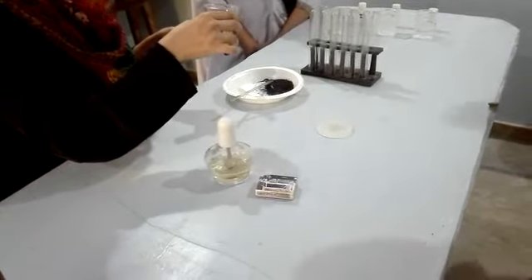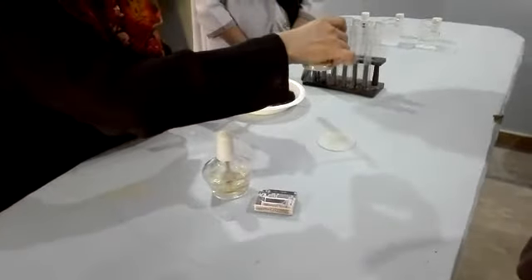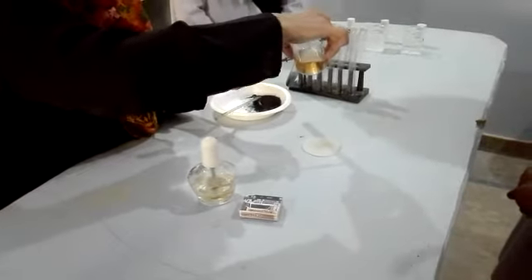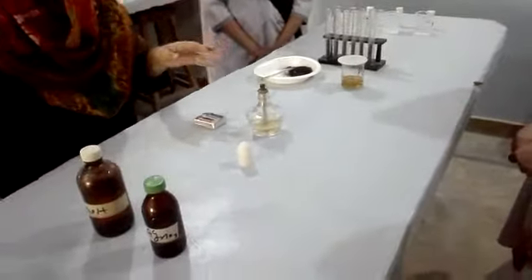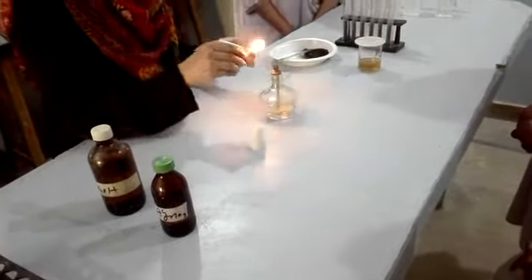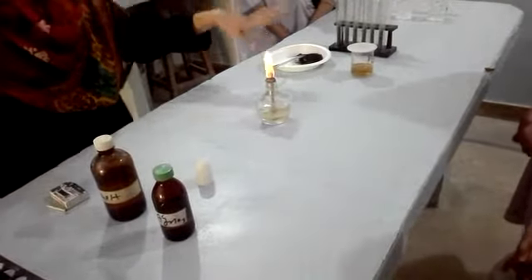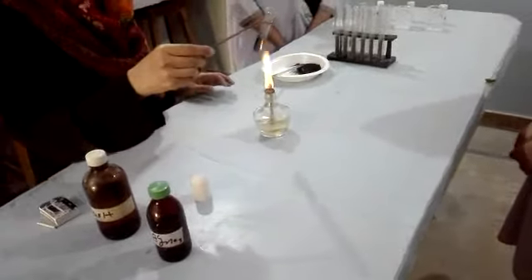Add some sulfuric acid, H2SO4. It is also known as the king of compounds and also known as oil of vitriol. After adding, you have to heat it gently. Always remember when acid is near to you, always put it some distance away. Now heat it.